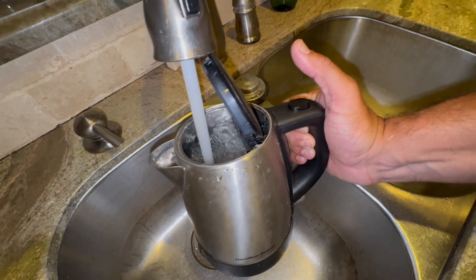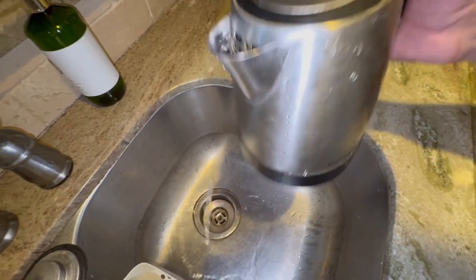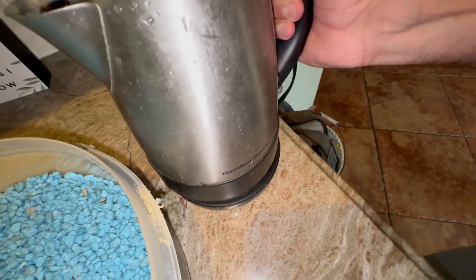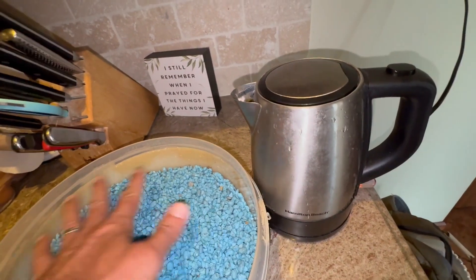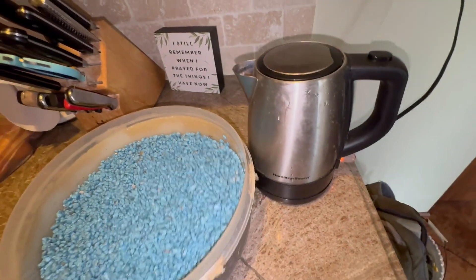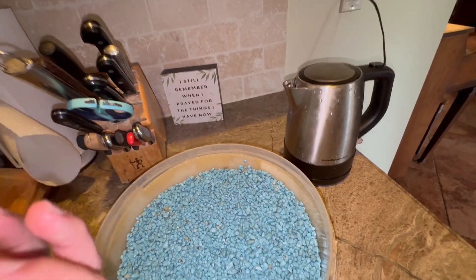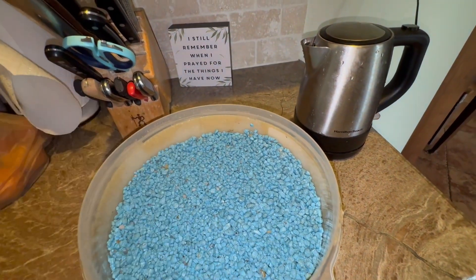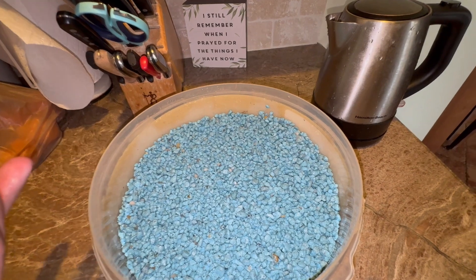The reason I dumped the water out is because I'm going to boil some water. The reason I'm doing that is because boiling water — hot water, steam — will rehydrate much, much, much faster than room temperature water. So if you have your water boiled and there's real hot steam going up into the atmosphere, it's only going to take a couple of hours for specimens to be completely pliable versus like 24 hours or a full day.